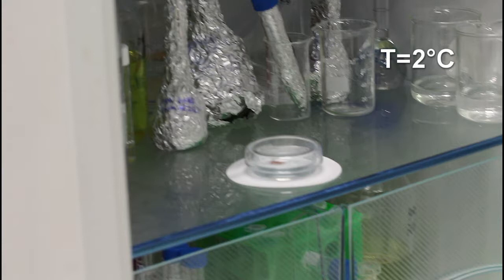We leave it in the fridge for copper etching. It will take a little longer than etching at room temperature, but not very much longer.